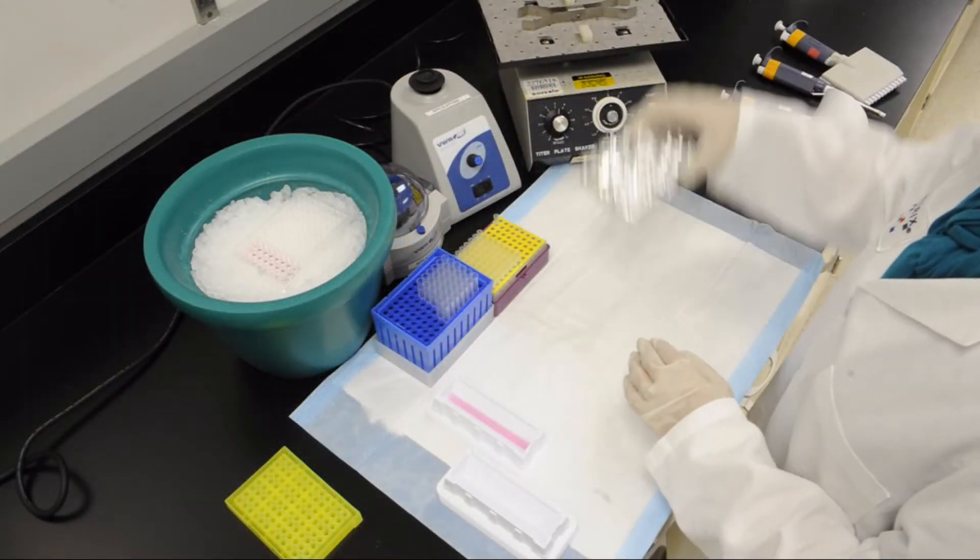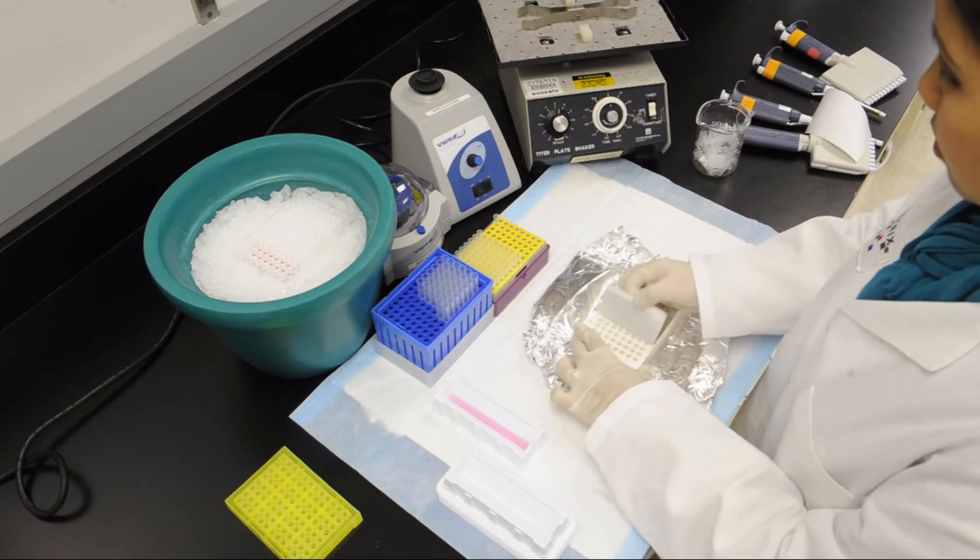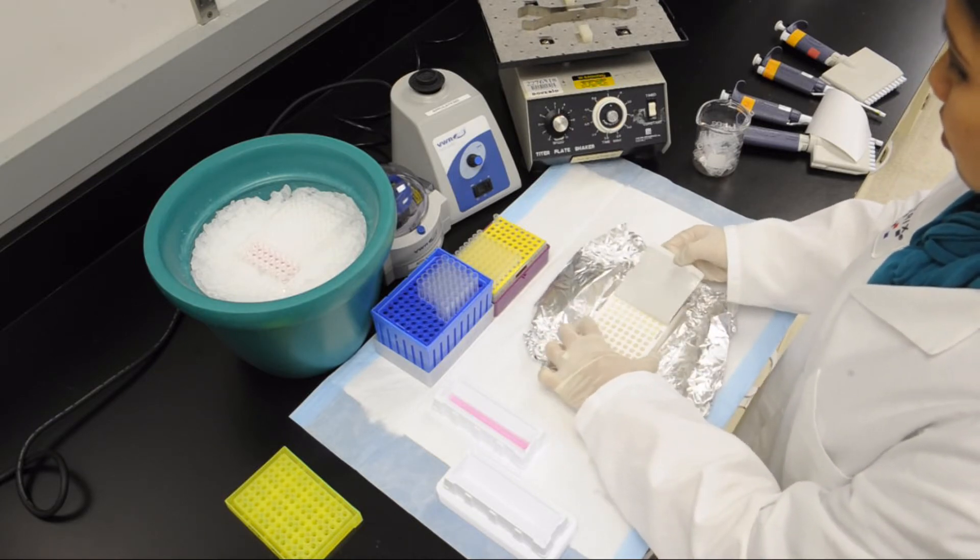After incubation, remove the plate from the shaker. Carefully remove the plate seal and proceed to the wash step.